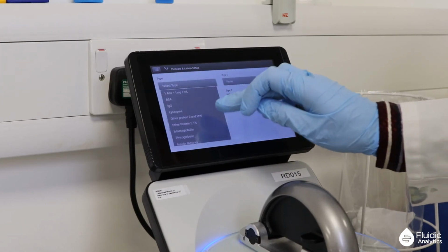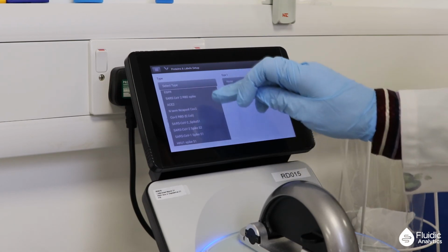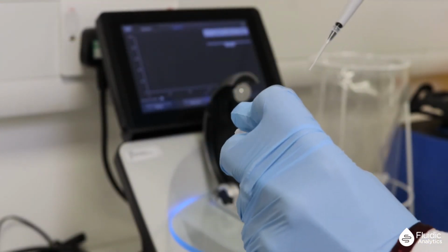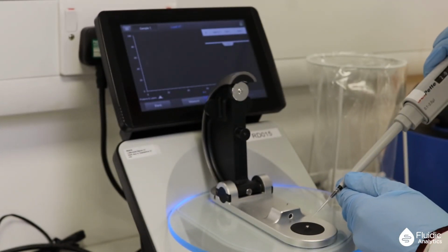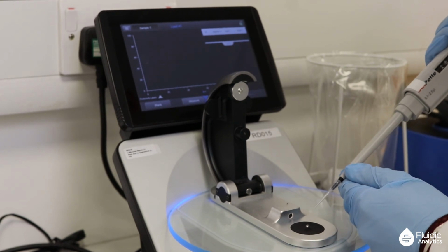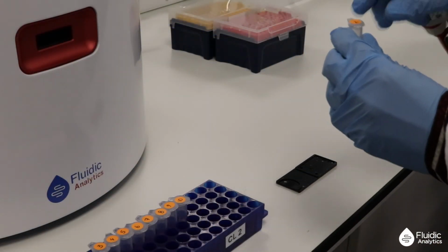Measure the absorbance of each fraction at 280 nanometer and the absorbance wavelength of your dye. The protein is expected to elute in fractions 2 to 4. This can be verified by a NanoDrop measurement and the amount of protein and degree of labeling determined. The late eluting fractions will show dye absorbance but not protein absorbance as they contain free dye. Pool protein-containing fractions as appropriate.